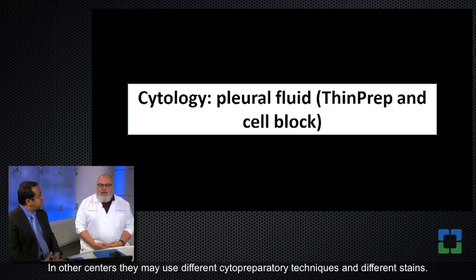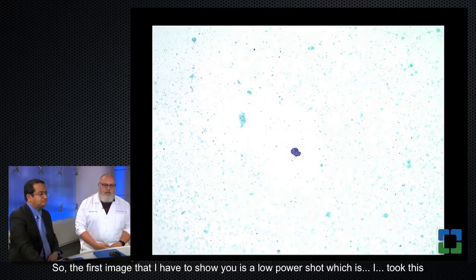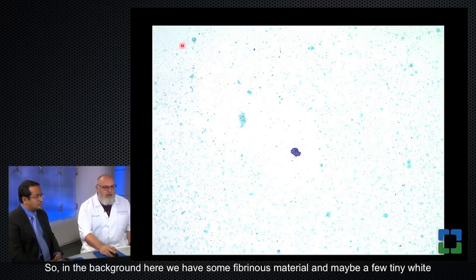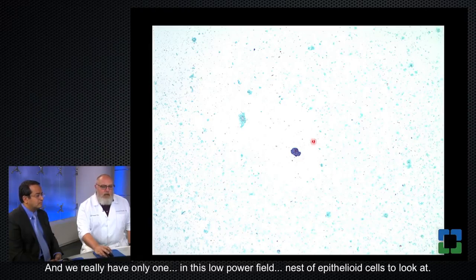In other centers, they may use different cytopreparatory techniques and different stains. So the first image that I have to show you is a low power shot, which I took to emphasize the fact that this specimen is actually of very low overall cellularity. So in the background here, we have some fibrinous material and maybe a few tiny white blood cells that are in these little fibrinous clots. And we really have only one nest of epithelioid cells in this low power field to look at.